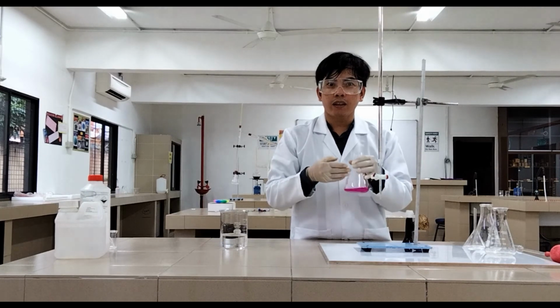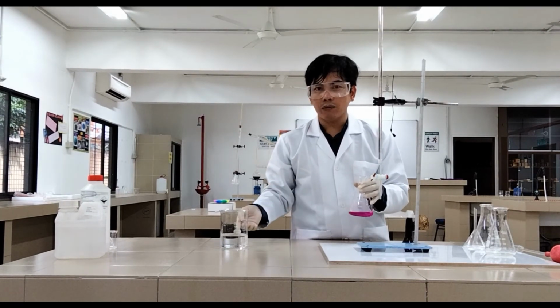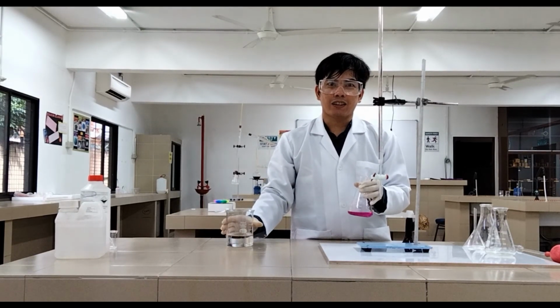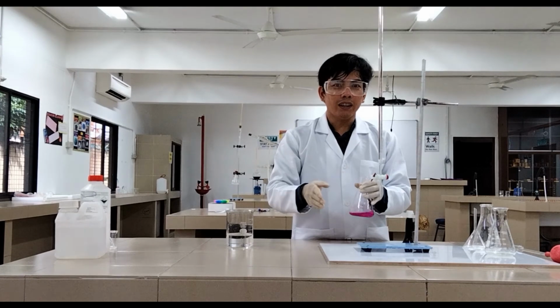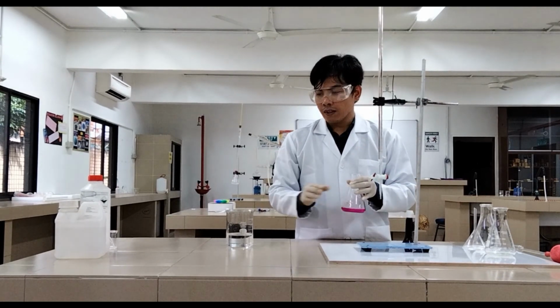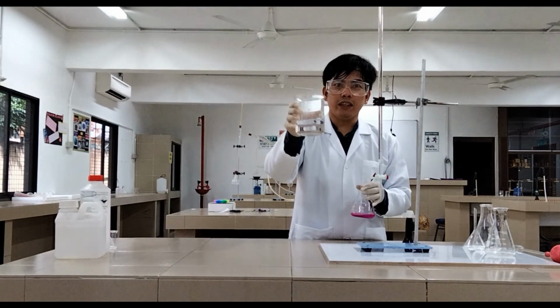But using an equation, which I am going to show you now, we can identify the concentration of this acid. Okay, so wait, and I'm going to show you how to solve this problem in identifying the concentration of this acid.